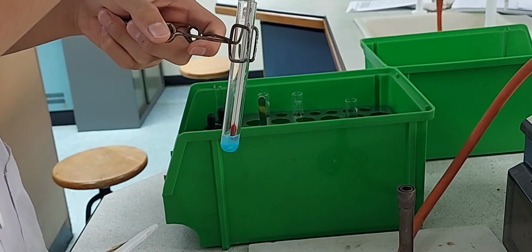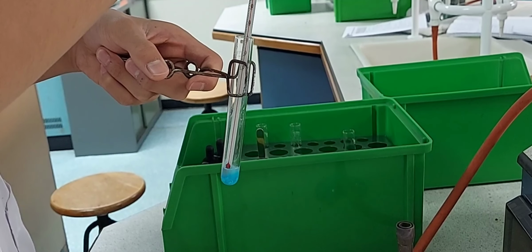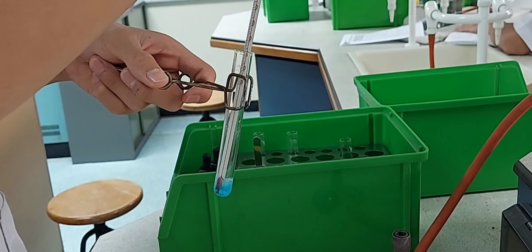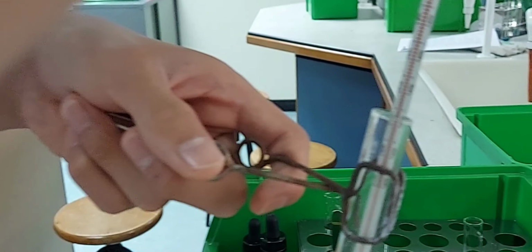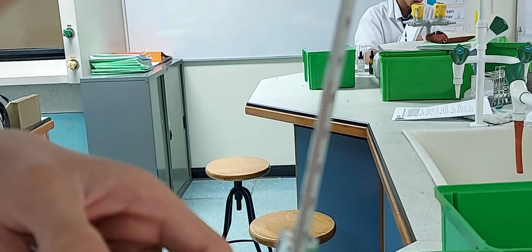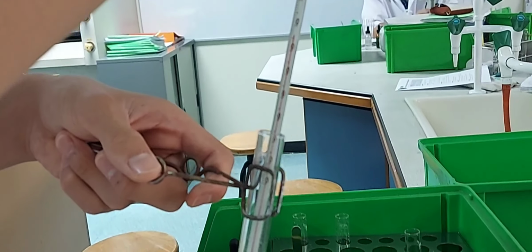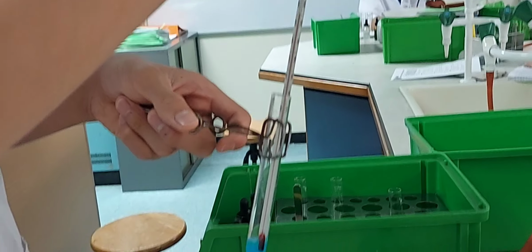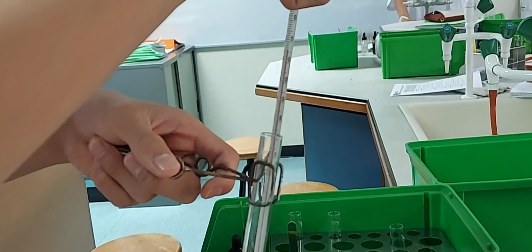The white powder has become blue again, and if you closely observe the thermometer readings, you'll find that as you continue stirring, the temperature rises. So this is an exothermic reaction, adding water to anhydrous copper(II) sulfate to get the hydrated copper(II) sulfate. And it is the reverse reaction of heating the hydrated copper(II) sulfate.